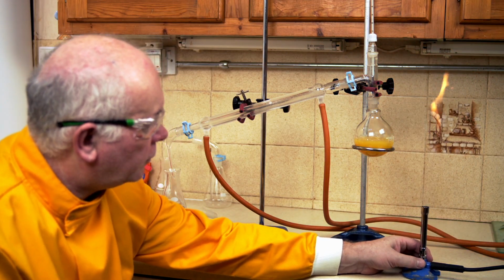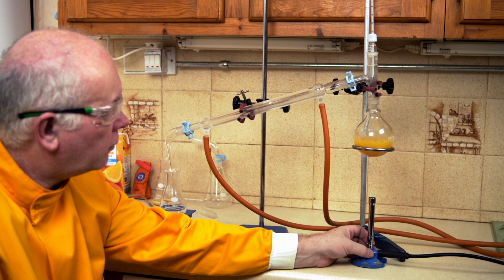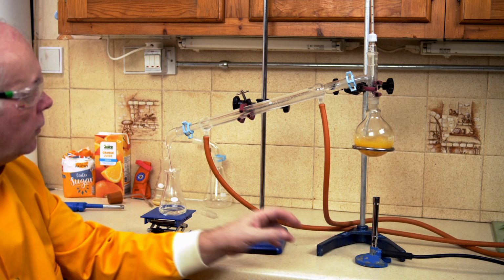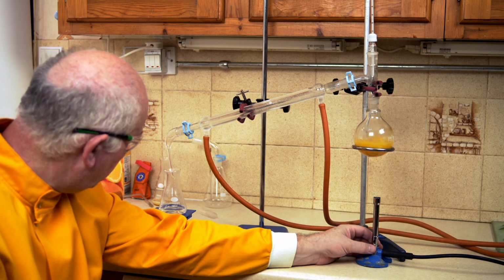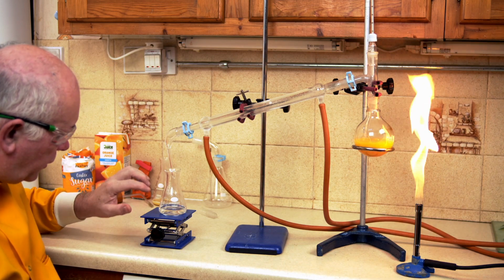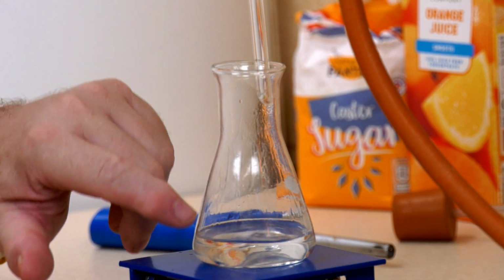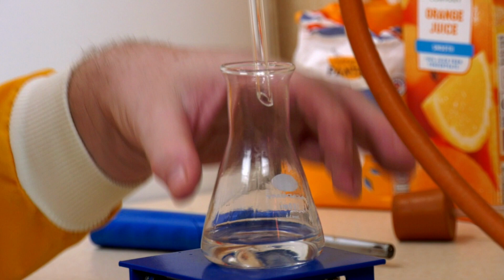And what we can do is just keep this gradually and gently bubbling so that all the alcohol in there can be collected off. And we can see the alcohol down the outside. And this is now coming out really quite quickly. Perhaps a little bit too quickly. But we can see the classic shape of alcohol on the outside of this container, where you often get little lines of the alcohol evaporating and then coming back down again.